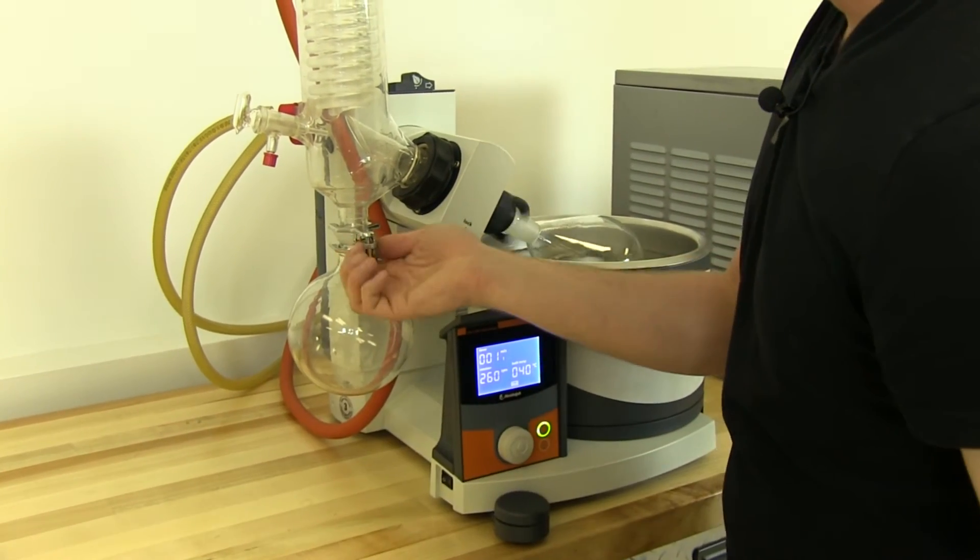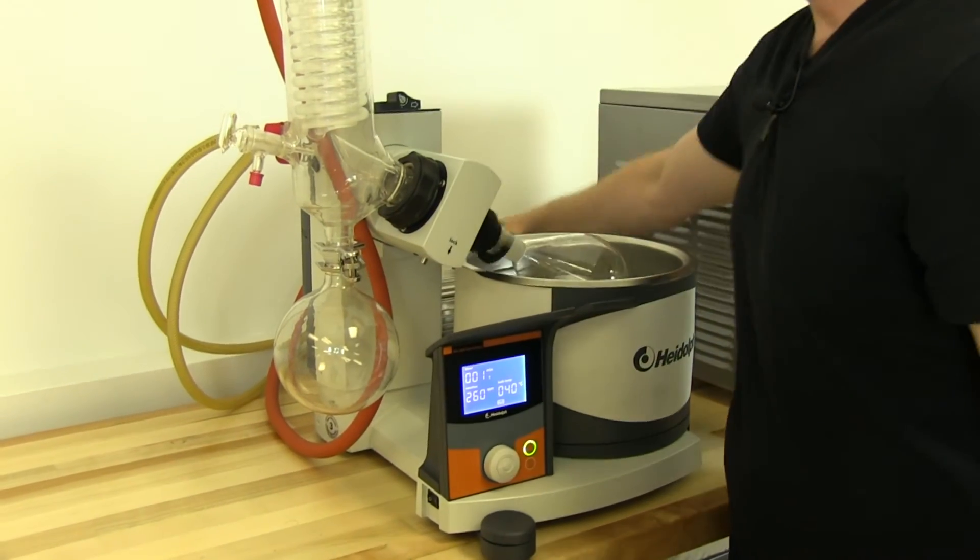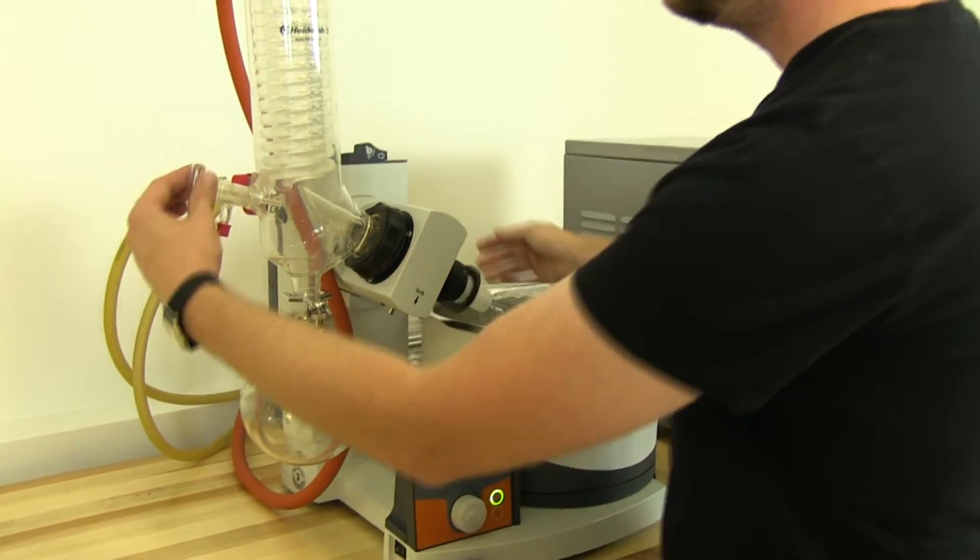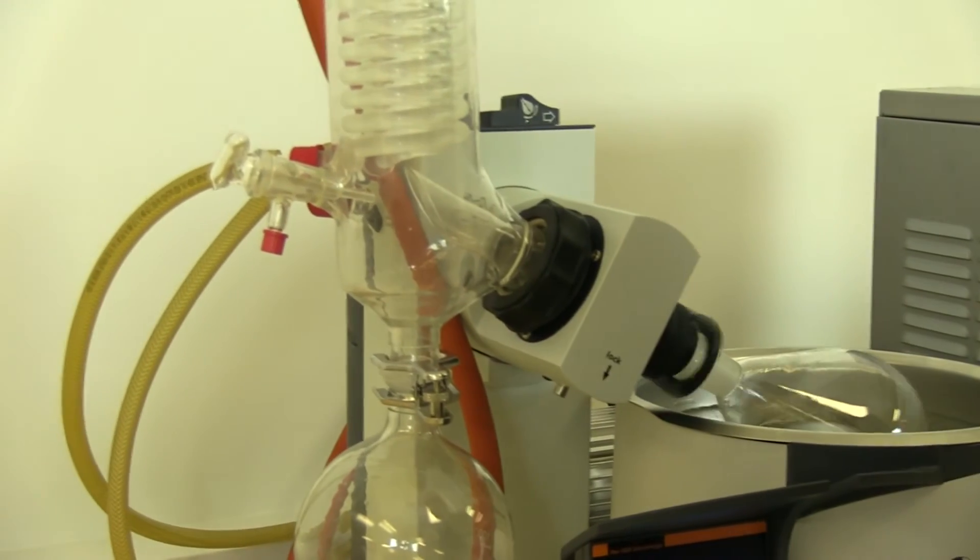Clamp it back on. Tighten it up. Turn on the vacuum pump. Make sure this is closed. You're back in business.